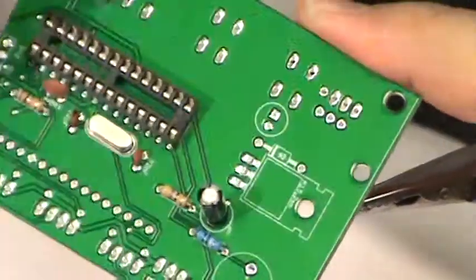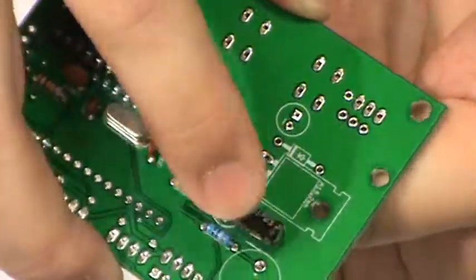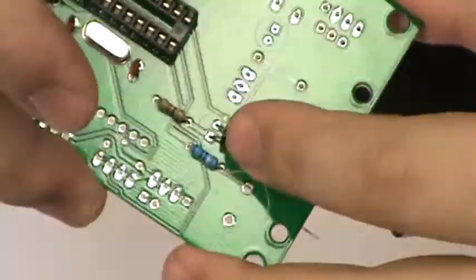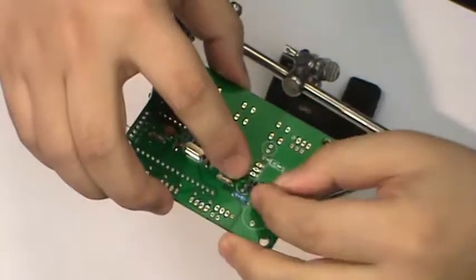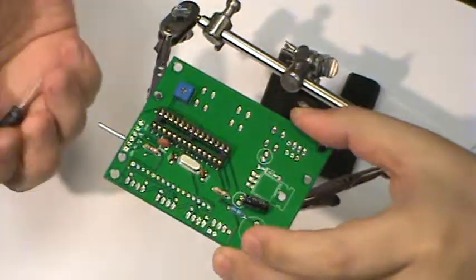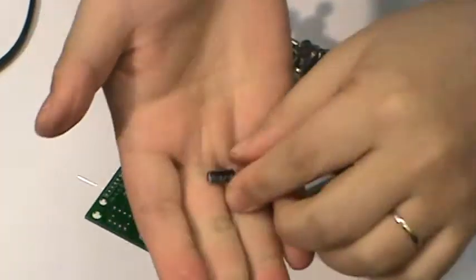Since we're thinking about lying the capacitor down, I'll just push up the capacitor a little bit and have it lie down. So this way we can save some space. Other side, flatten this. There's the other one, negative to right here. Okay, so this one we can have it lie down, just like that. Turn this around. Okay.